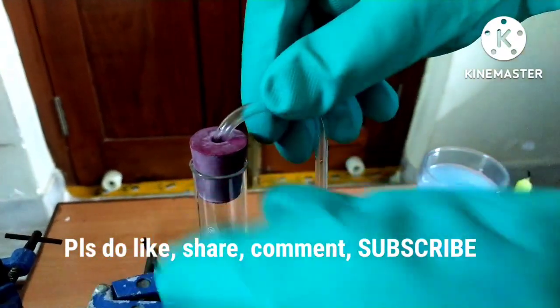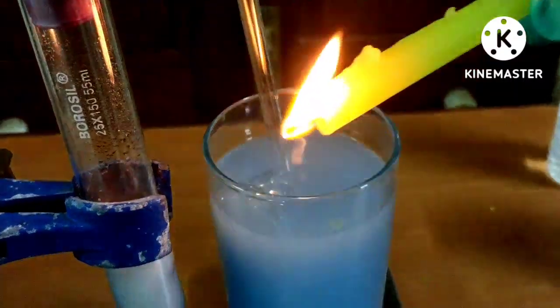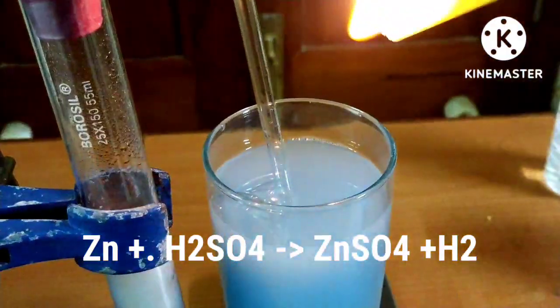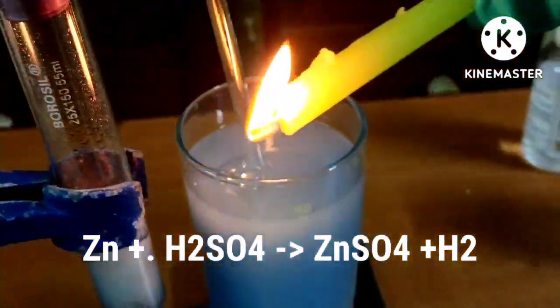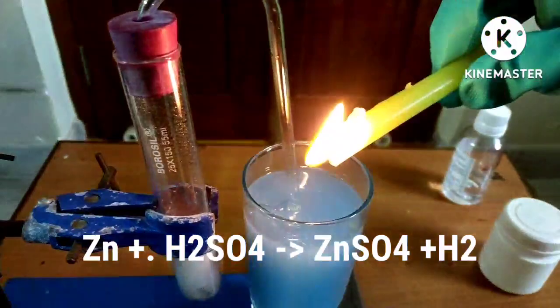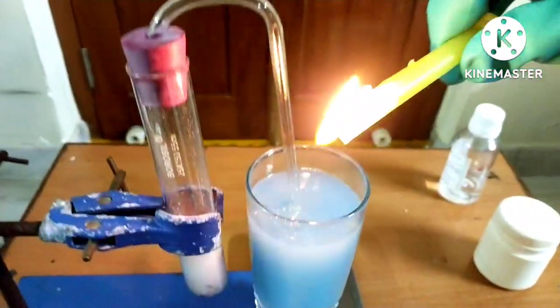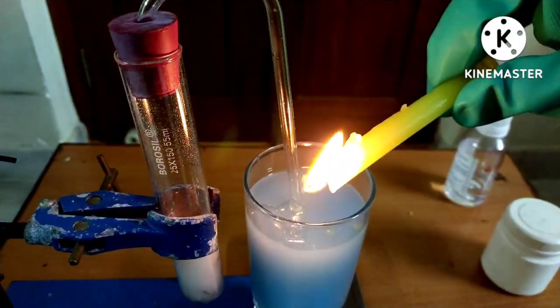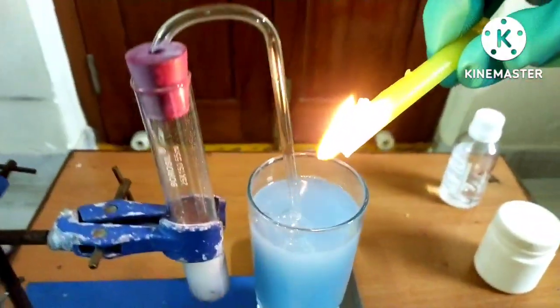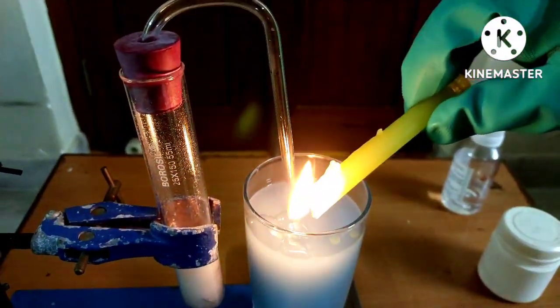Repeat this experiment with Dilute HCl and HNO₃. We find the same observation as the H₂SO₄ experiment. From this activity we can conclude that Hydrogen gas is produced when acid reacts with metals.